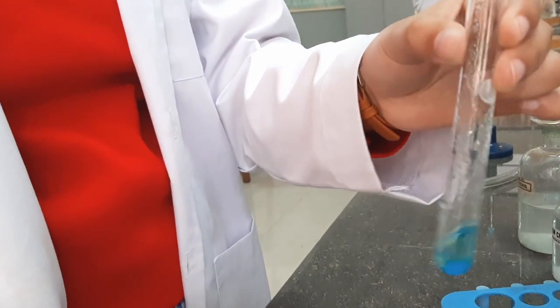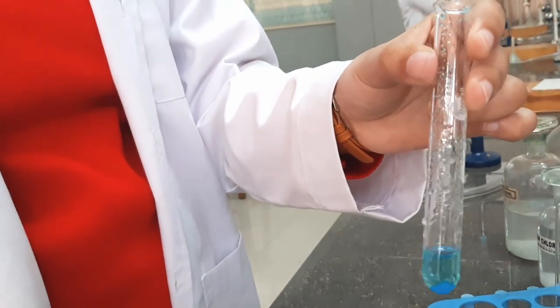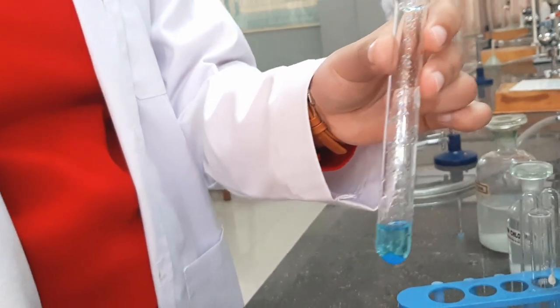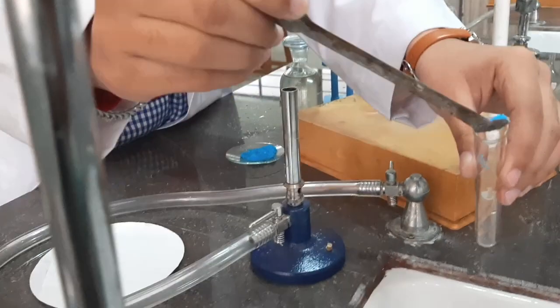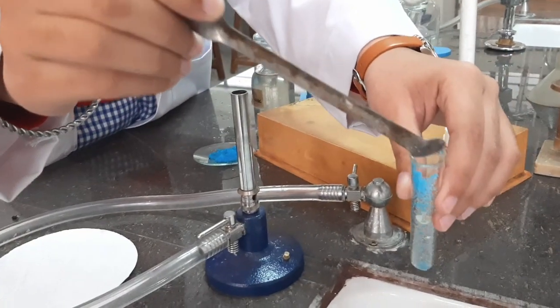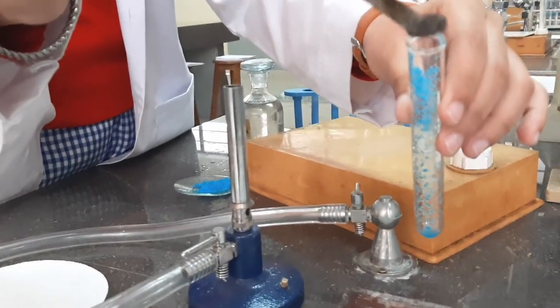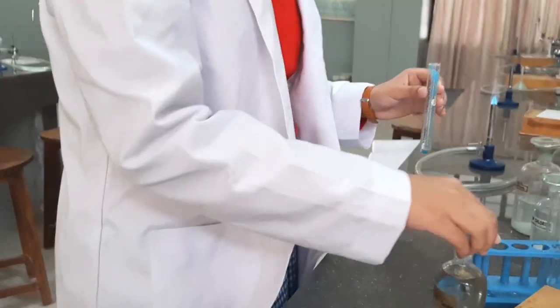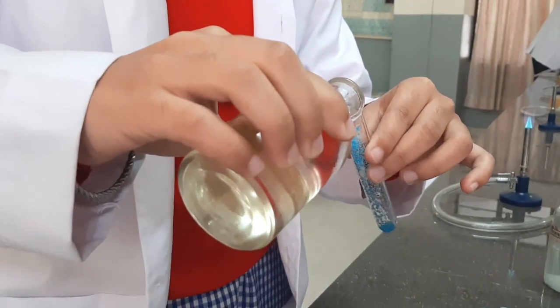No change means dilute acid group radicals like carbonate, nitrite, sulfide are all absent. Another sample of solid salt — copper sulfate. Now we are going to add concentrated sulfuric acid and again look for any change.